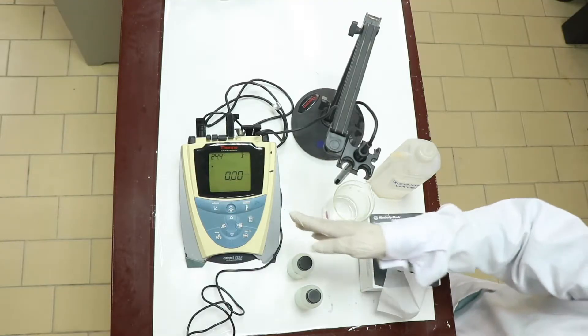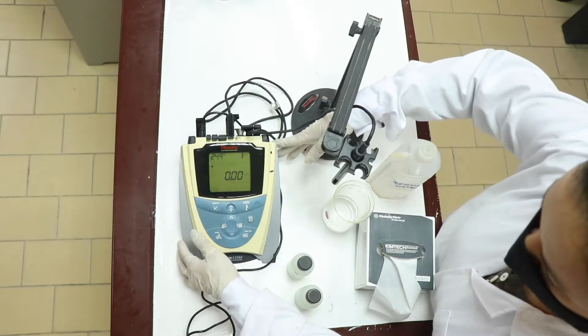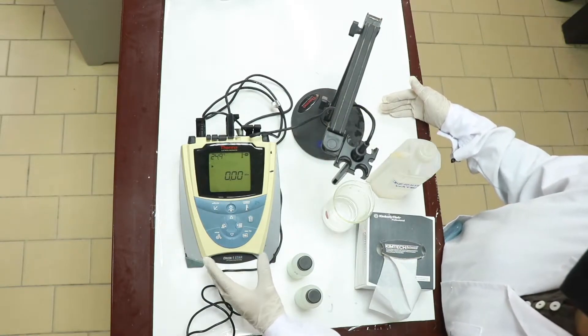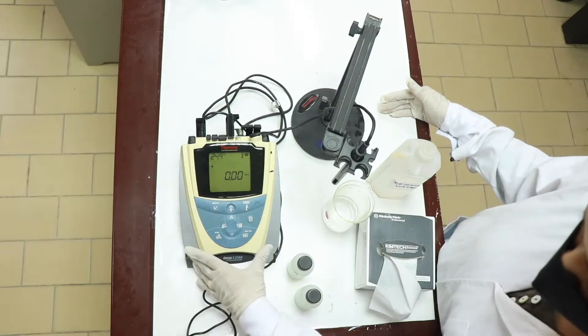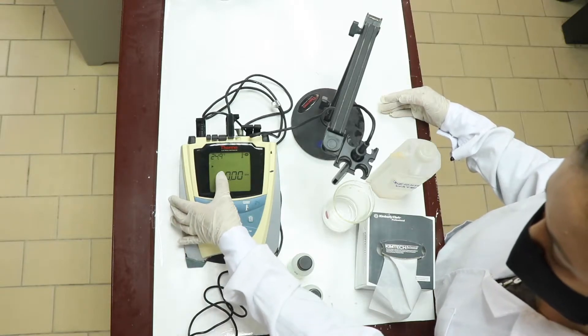The conductivity meter is now switched on. As I explained before, this is actually multifunctional. It can be used to read the pH as well as the conductivity.